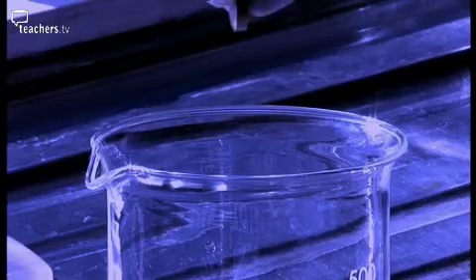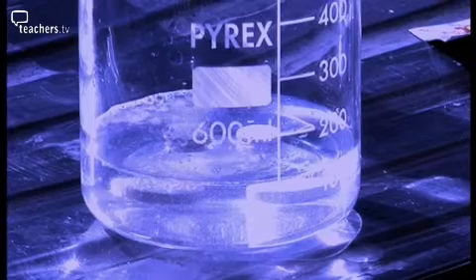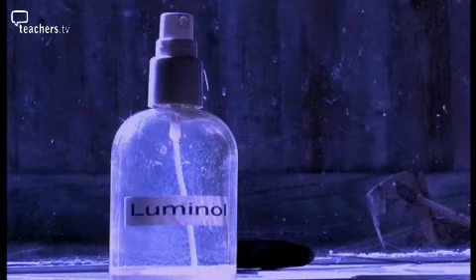We also have another tool in our chemistry box. It's a technique using a chemical called luminol. Now this is highly sensitive. Luminol is just a chemical called luminol and hydrogen peroxide. So the same way that Kastle-Meyer has hydrogen peroxide in it, with phenolphthalein, luminol is luminol and hydrogen peroxide.